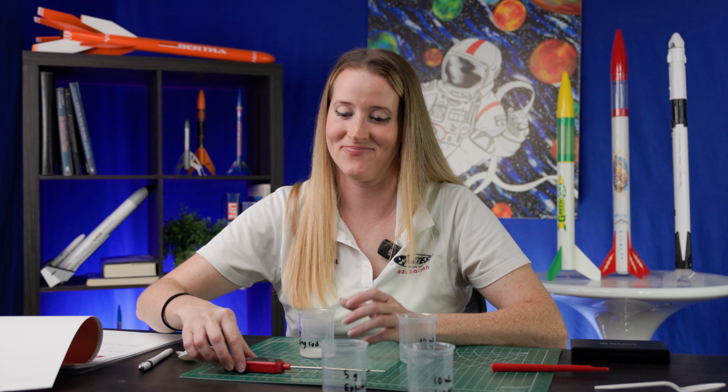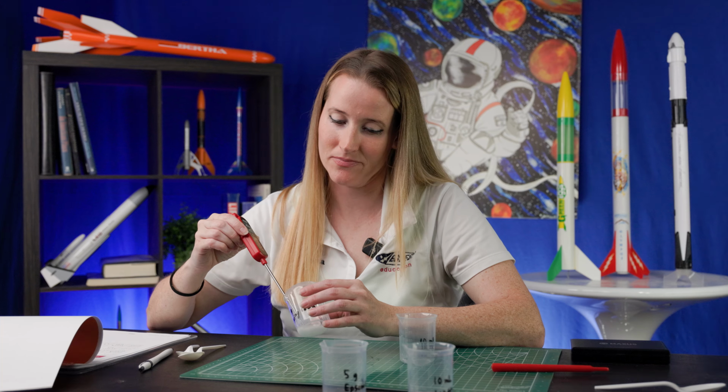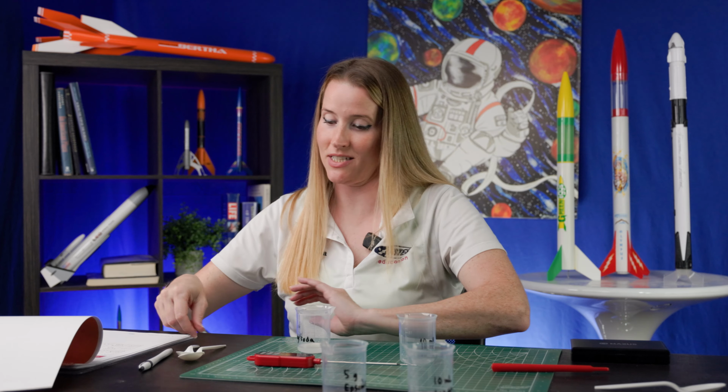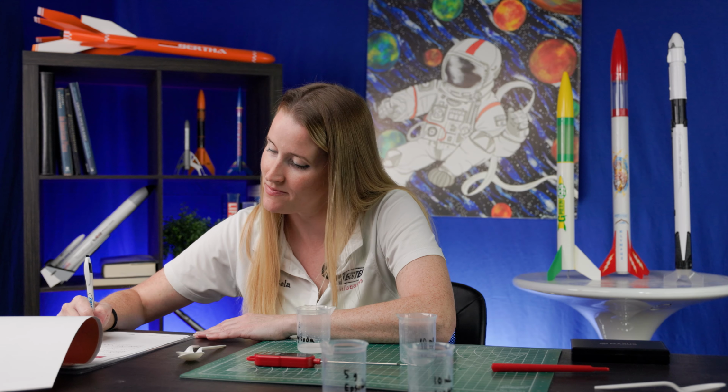Now we're gonna wait 1 minute. All right, it's been 1 minute, let's check. 17.4 degrees Celsius. That means we had a decrease of 5 degrees Celsius.